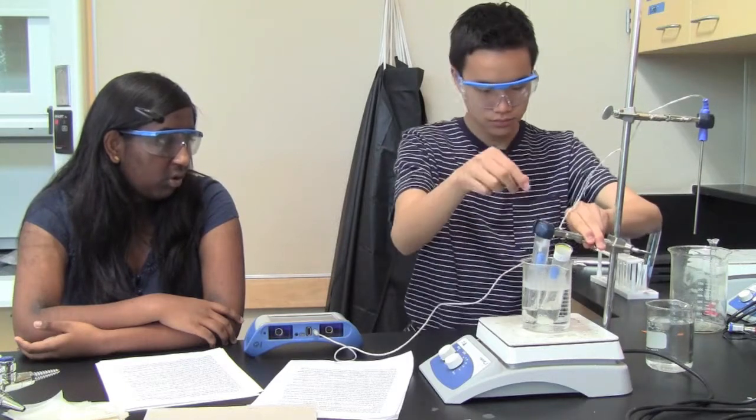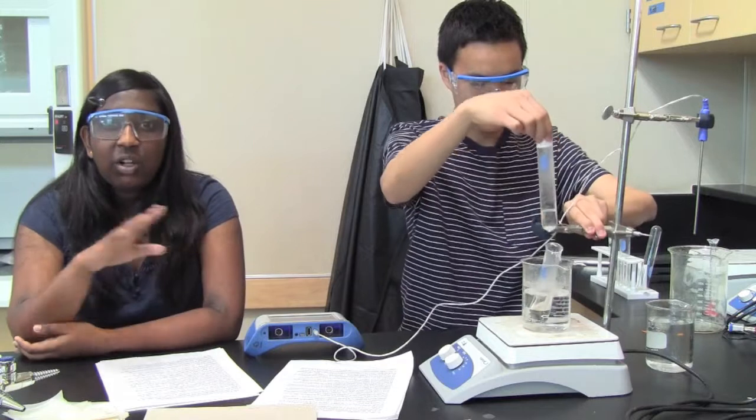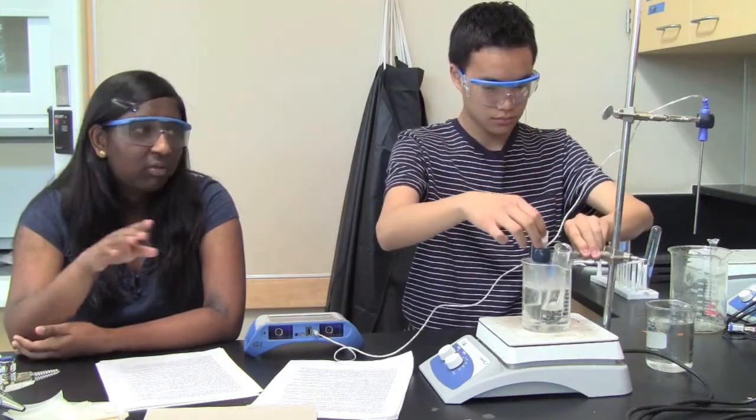Same thing. Don't let it fall on you. Don't touch the bottom of the test tube. Warning, we have warned you now. If you don't listen to us, then you're not going to finish it during break. You don't want to do that. Really, it just ruins your day.